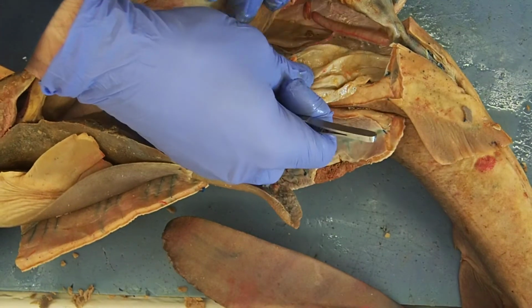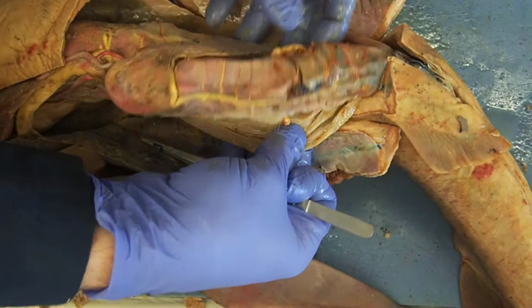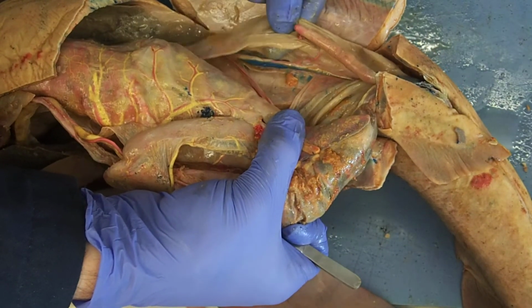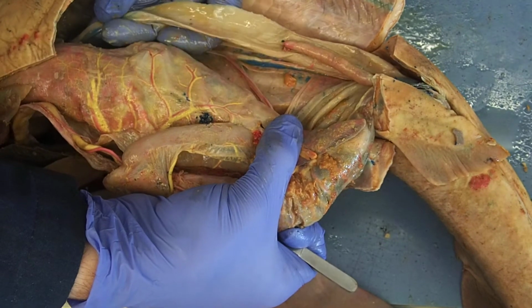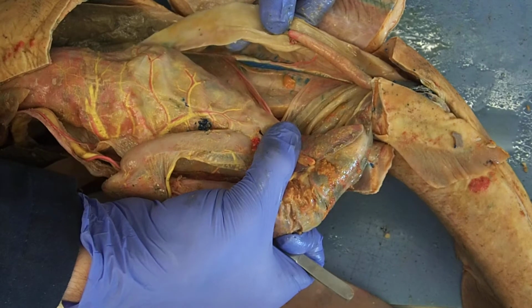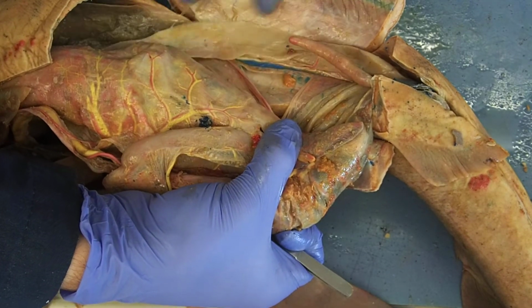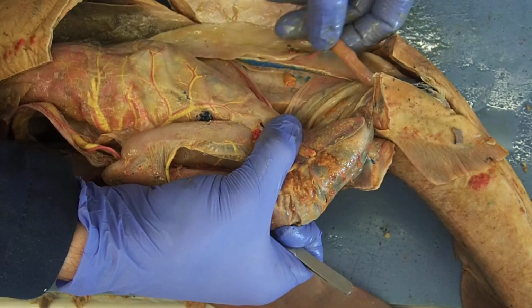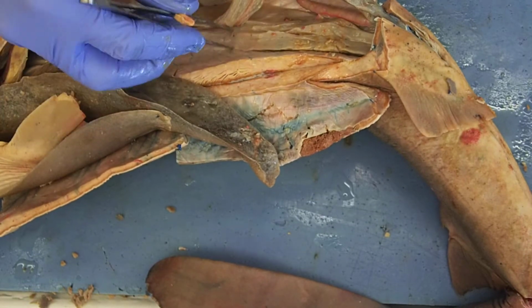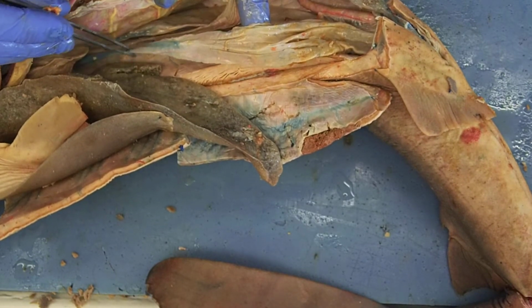The shark has two. So here's one I'm holding on to. If I flip everything over, on the other side, I have another uterus. Goes into a uterine tube or an oviduct. Oviduct further up. Uterus. Oviduct. Notice here's my digitiform gland. We've talked about that before. Helps with osmoregulation. Let's go back over here. Here is my uterus. Here is the oviduct.